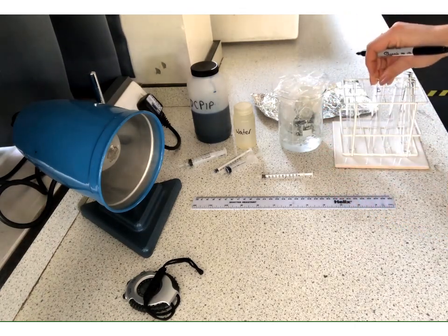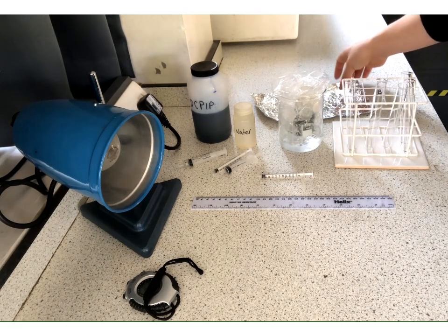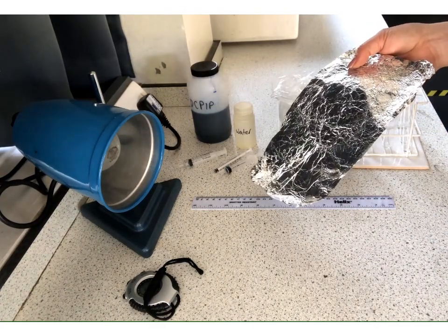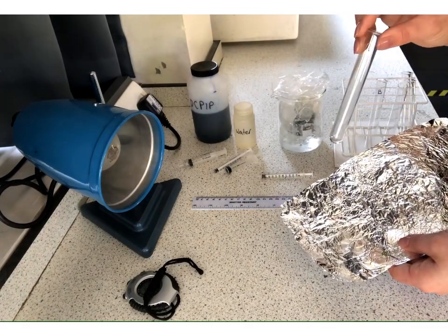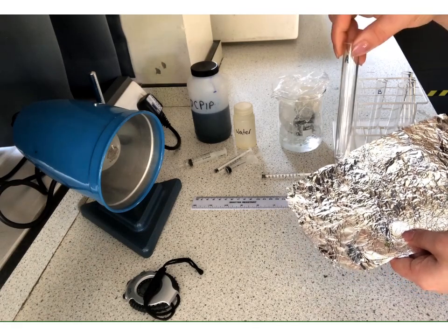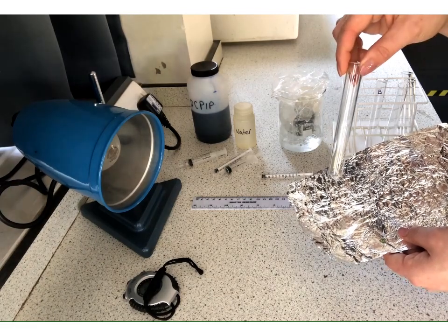Okay. Now what we're going to do is in tube A, we are going to add 5 centimetres cubed of the DCPIP solution, 1 centimetre cubed of water, and 1 centimetre cubed of chloroplasts. But the important bit here is after this, we are going to wrap that tube with this aluminium foil. The idea for this is that we are going to exclude all light from getting to the chloroplast. So we are hopefully going to stop the chloroplasts from carrying out the light dependent reaction.